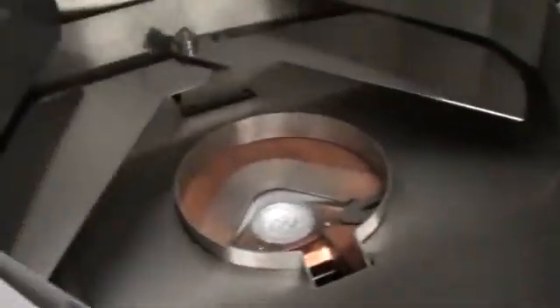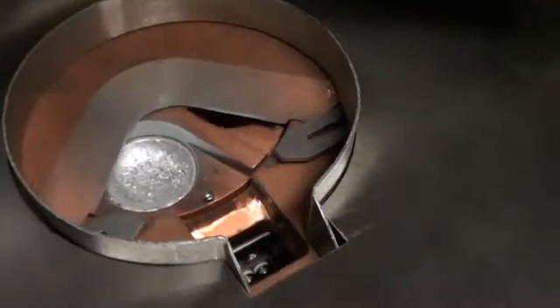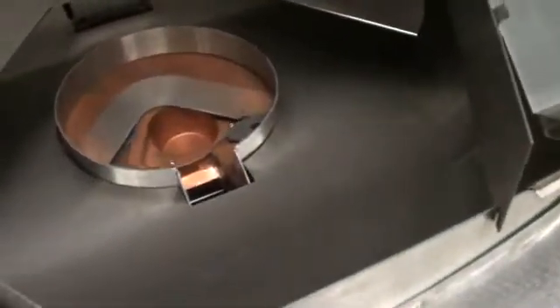Brand new shutters. Do you need a little more air pressure? Increasing air pressure. That will be adjusted. Rotate gun — gun control, pocket number two. Now, that aluminum is there just for testing purposes — I just want to make sure we're all on the same page. Correct, that's for testing purposes.